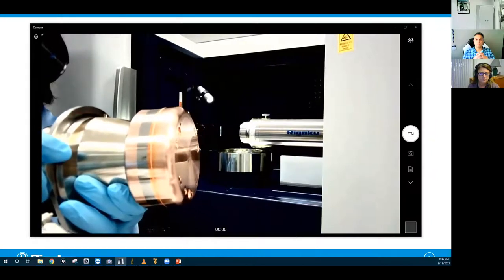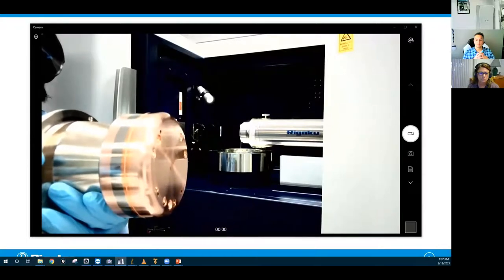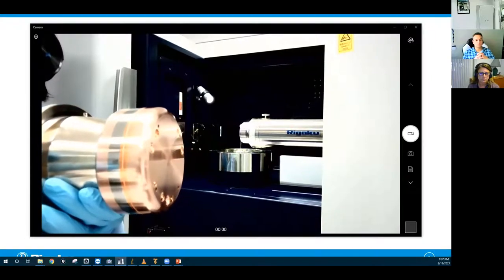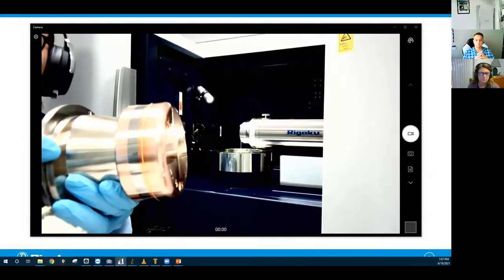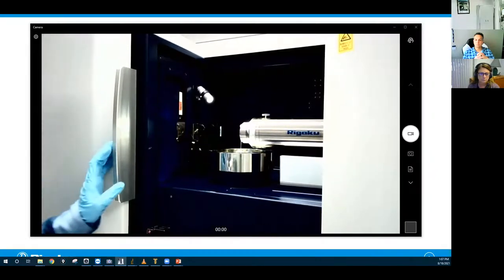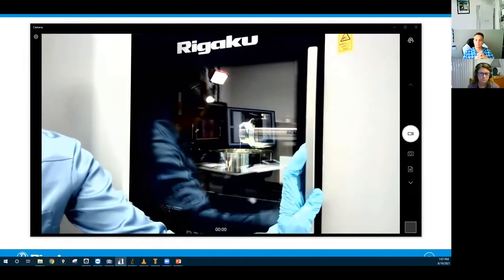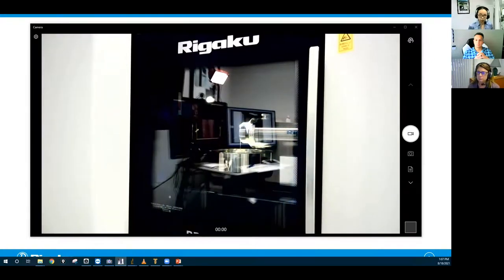And this entire anode goes in and out so that you can have the electron beam hitting different locations. But this is how the rotating anode generator kind of works and how you can switch between two anodes. And if you want to use more than two anode materials, then this anode cup is exchangeable. So you can take the entire thing out, as I was showing you, and put another combination of two different anodes in to use different radiations. So that's the machine we're gonna use.